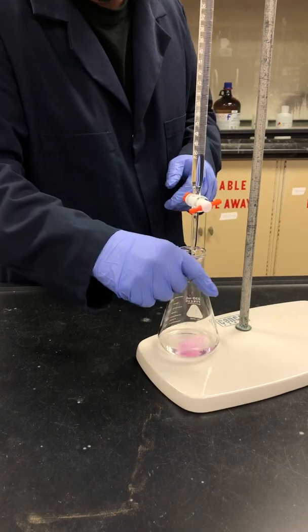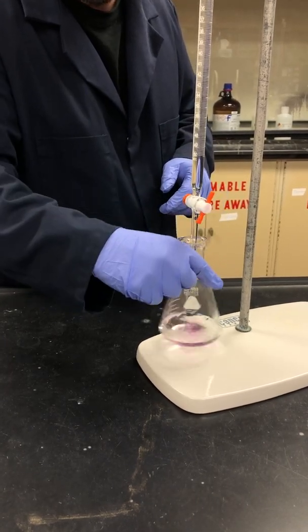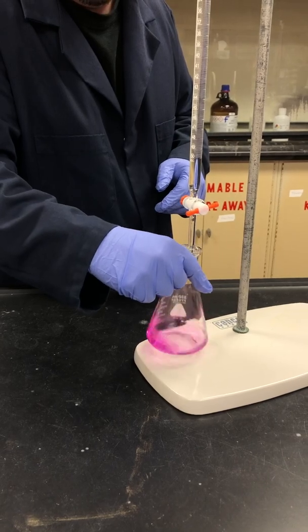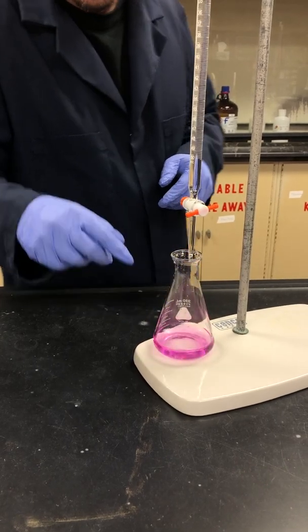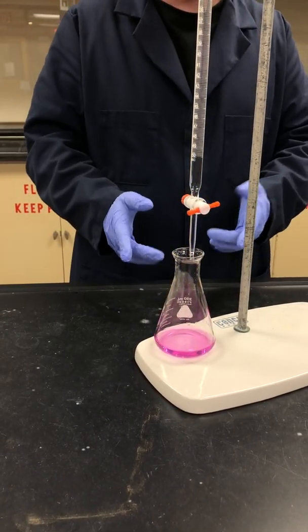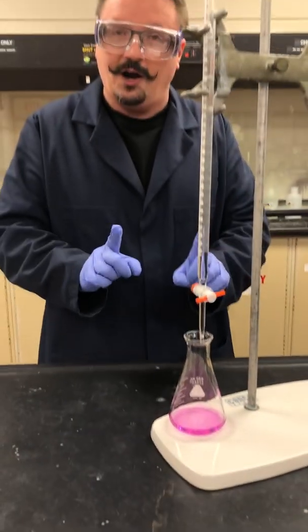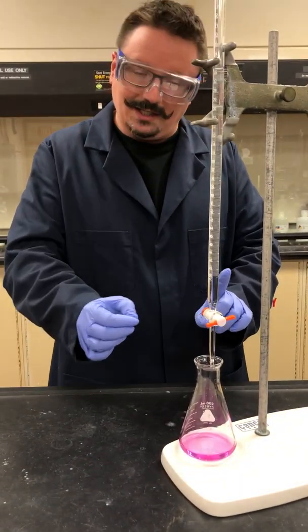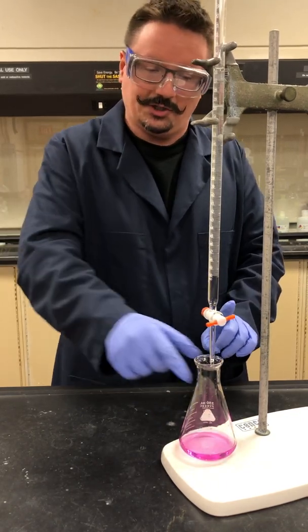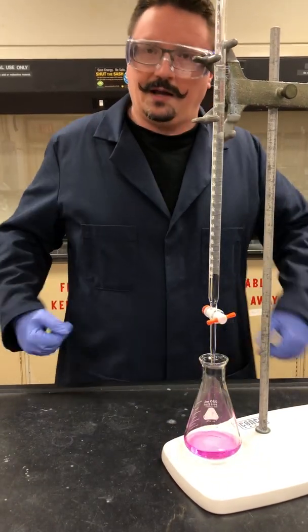So when we get to the point where that pink color persists, that's what we would call the end point. This is technically just a little bit past the equivalence point. At the equivalence point, the acid and the base are equal. And when we go just a little bit beyond that, I have a little bit more base, the pH is going to shoot up and we're going to see that pink color appearing.